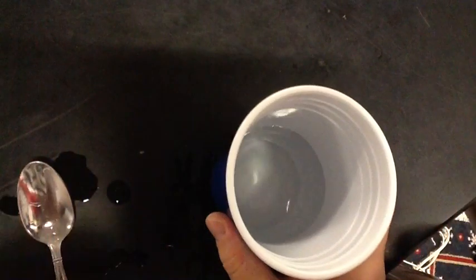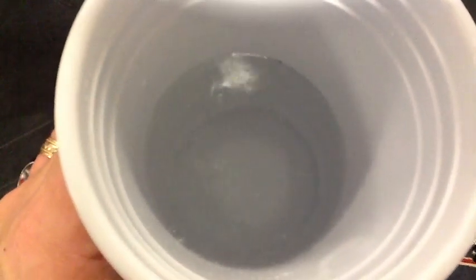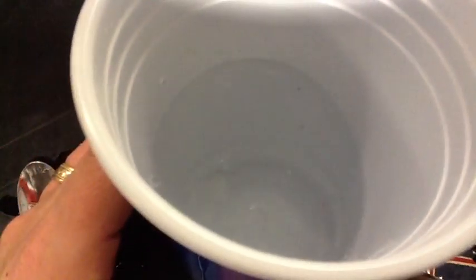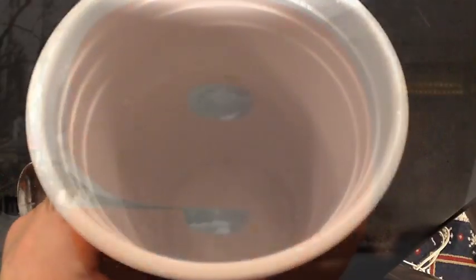I've got water and a tablet. There's bubbles. See the bubbles? Physical or chemical?